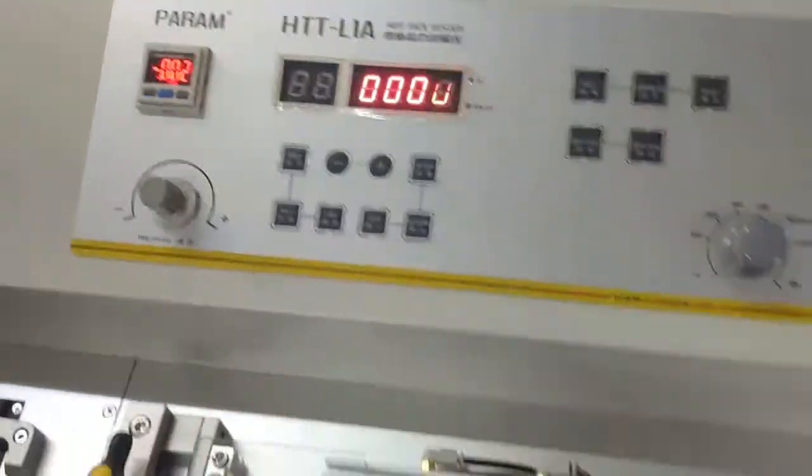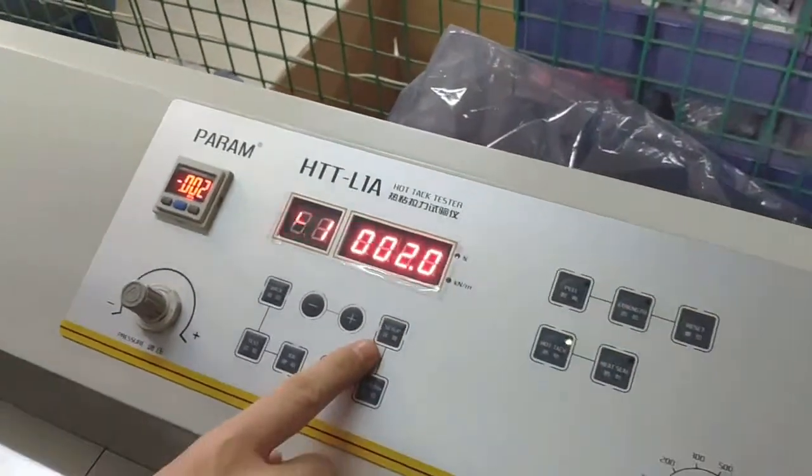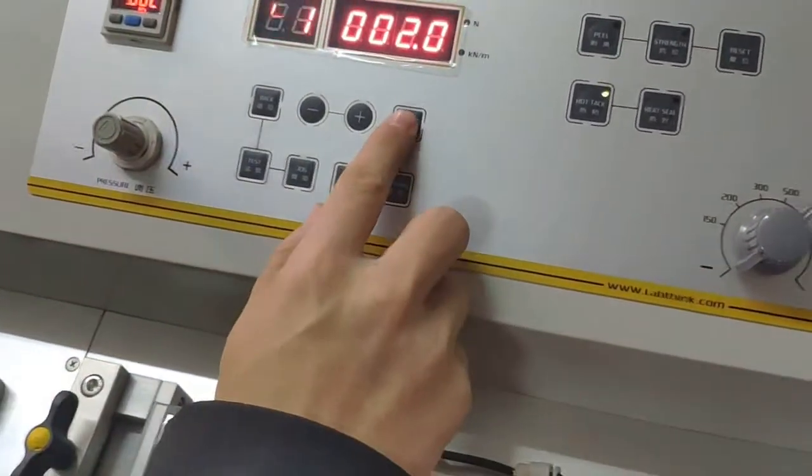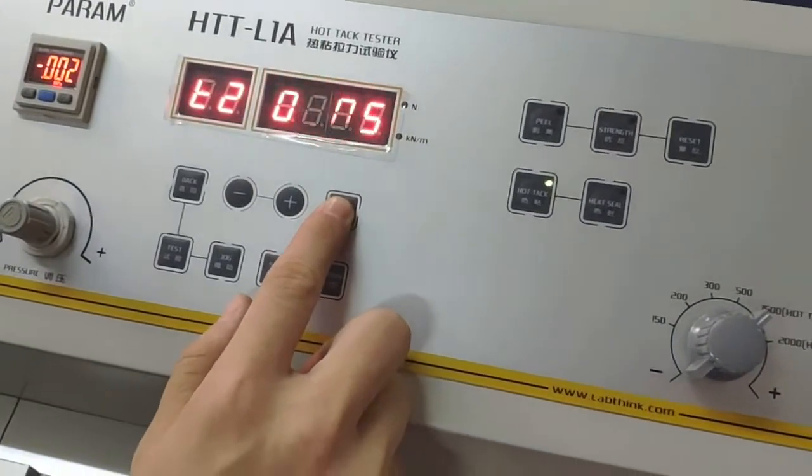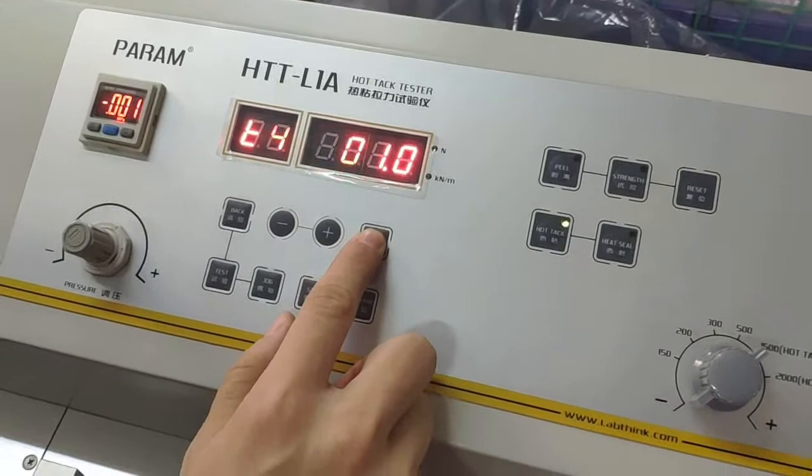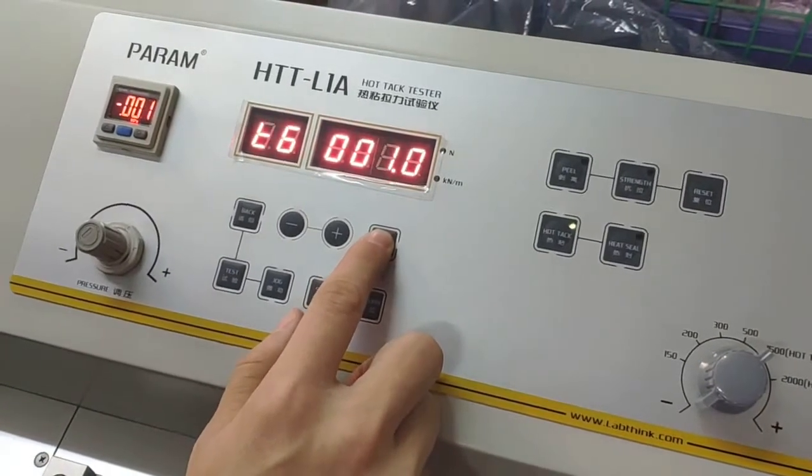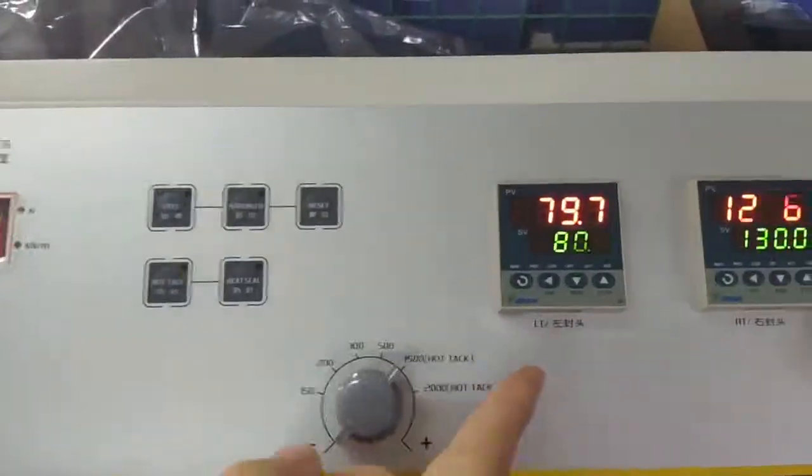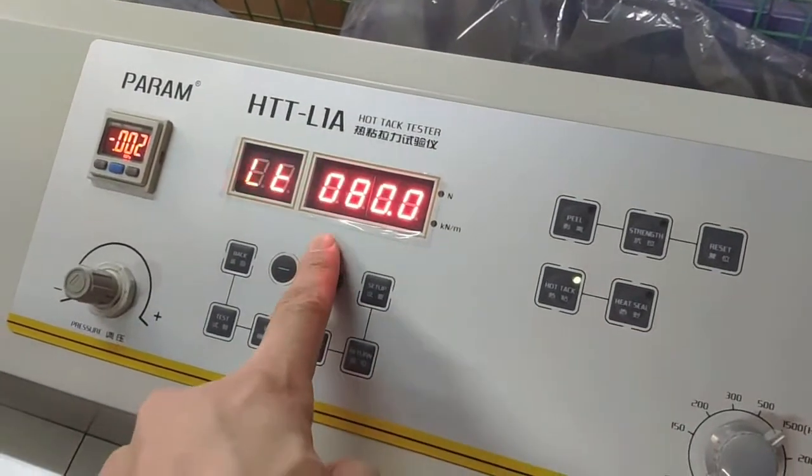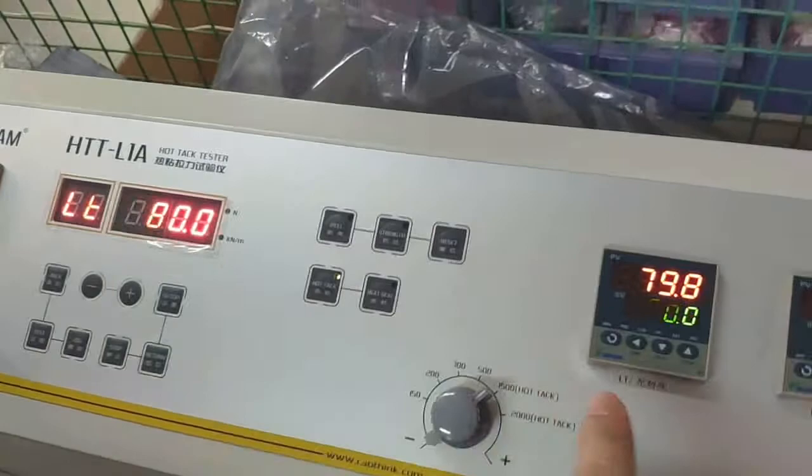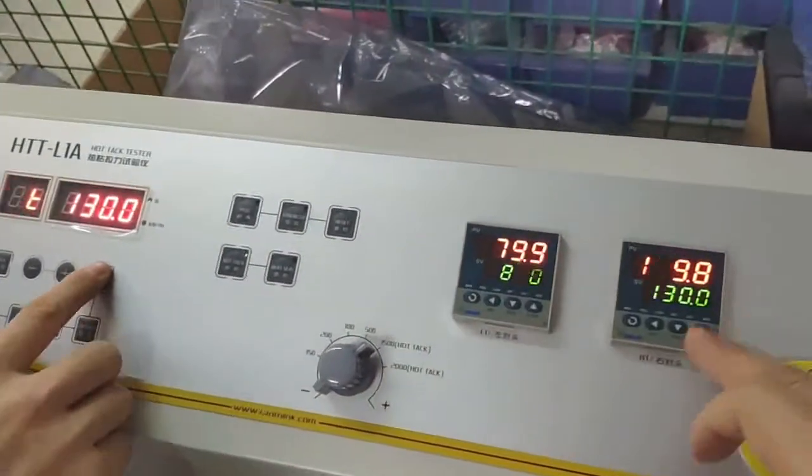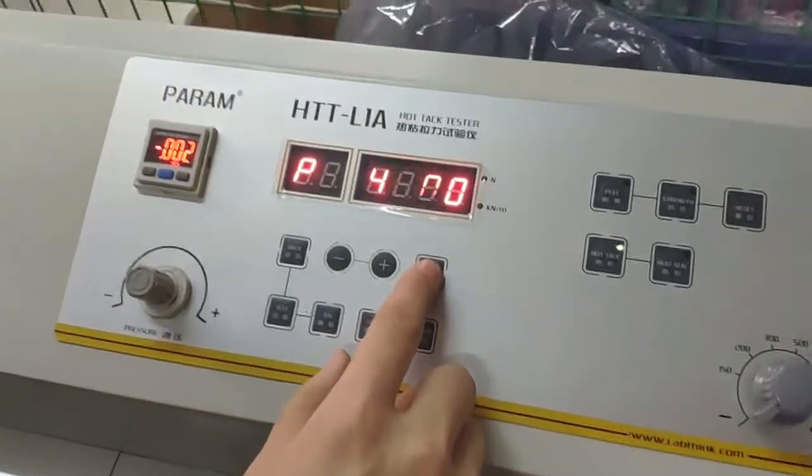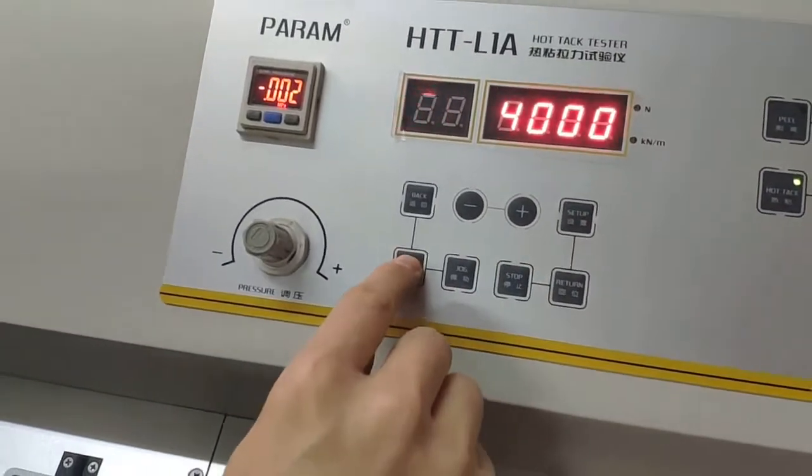Press the setup button first. You can see the first parameter LT, then T1, T2, T3, T4, T5, and T6. LT is the left temperature, only for showing in the report. Make sure the temperature here is the same as this one. The next one is the right seal temperature. This is the pressure parameter. Let's see how to make the pressure setup.